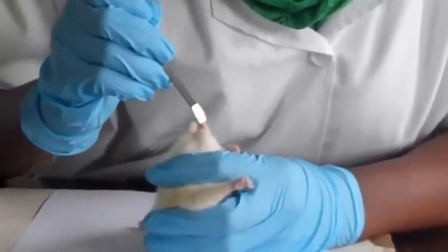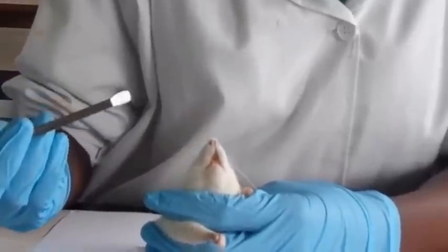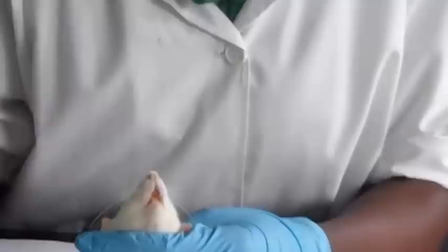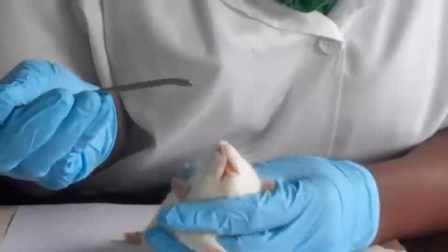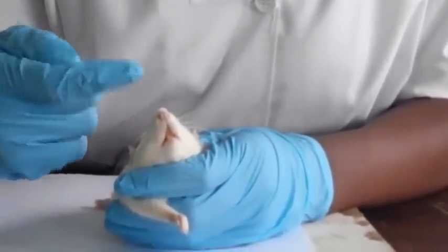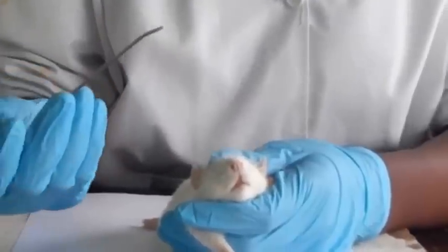It has incisor teeth, which are 2 pairs. These 2 pairs of incisor teeth are long, curved, sharp, and hard, for cutting and biting food and for defense against predators. It has nostrils, which are right here, 2 nostrils, and they are very tiny, hollow, moist, and comma shaped, and the main reason why they are hollow is for passage of gases within them.